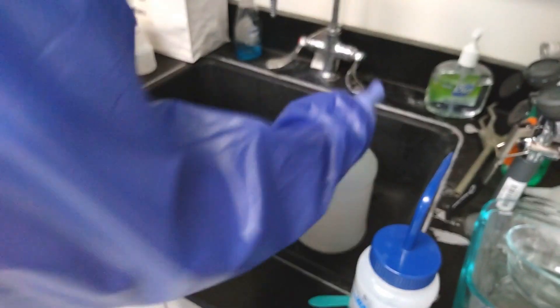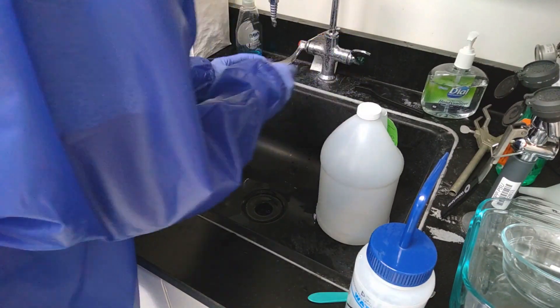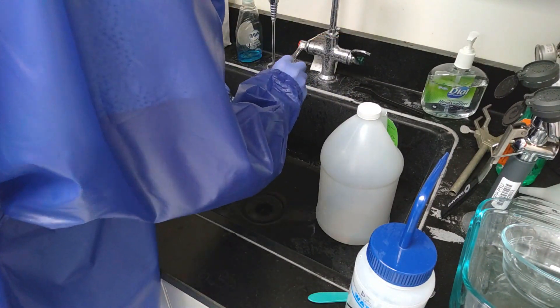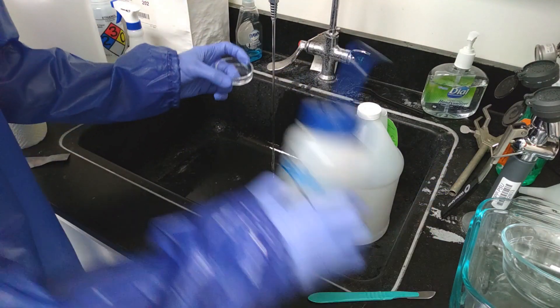Between etches, it's important to clean the dish and the electrode ring free of any debris, as this will cause asymmetry during the etching.